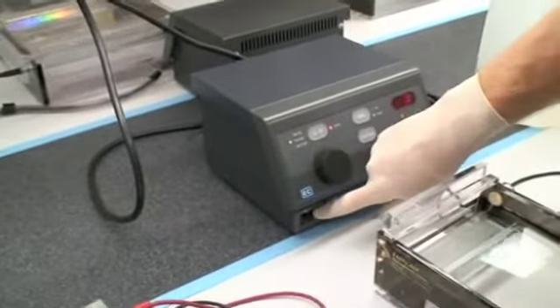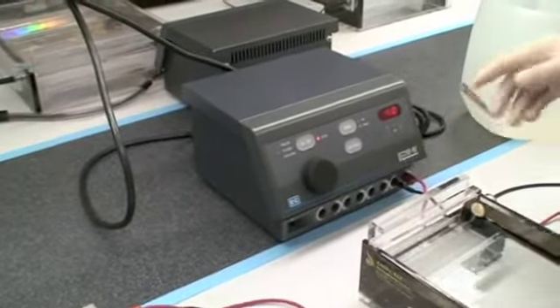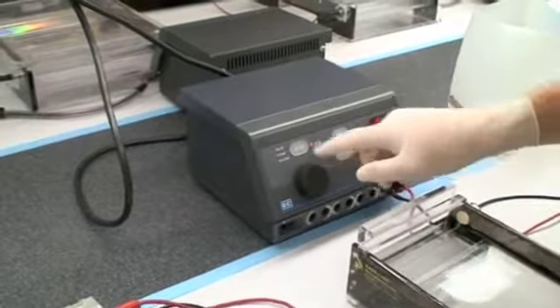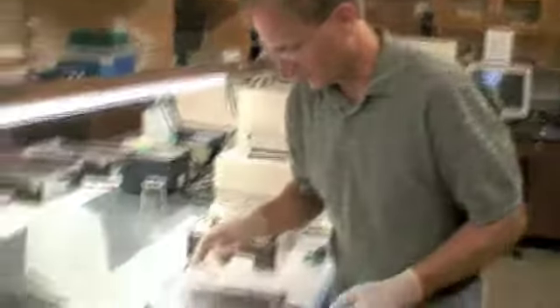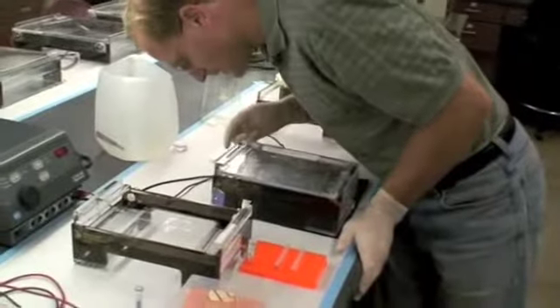This is on and off for the current. This is on and off for the box. So you have to turn on the box first, adjust it how you want, set the voltage, and then hit on for the current. Now, one thing I always like to check.